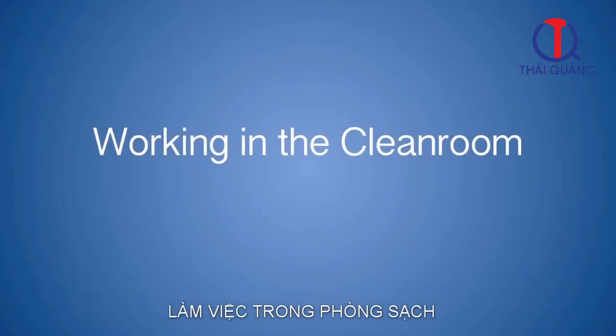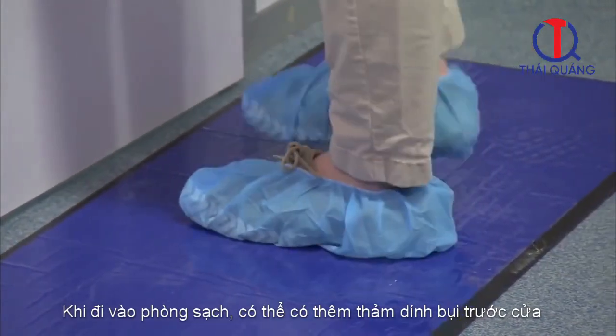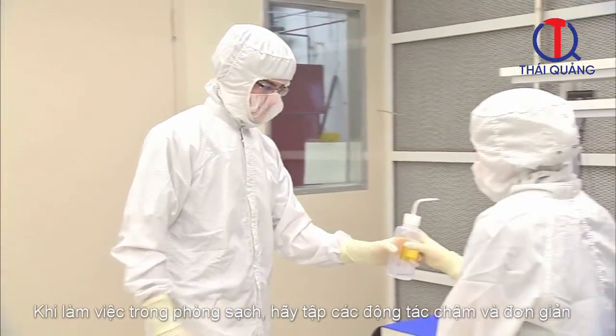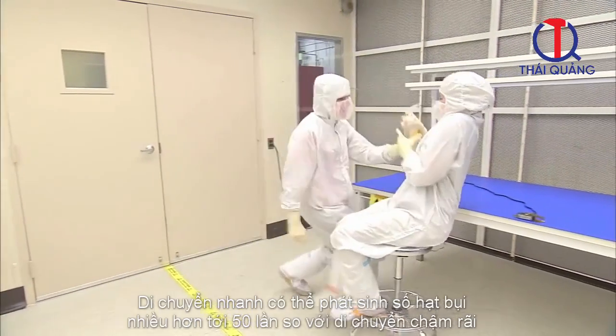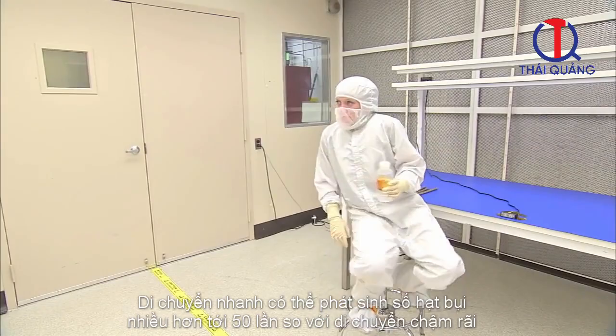Working in the cleanroom. When entering the cleanroom, there might be another adhesive sticky mat in front of the door. Be sure to step on it before entering. When in the cleanroom, practice slow and methodical movements so as to minimize the amount of particles you release in the air by moving. Moving around quickly can introduce nearly 50 times as many particles as moving slowly.